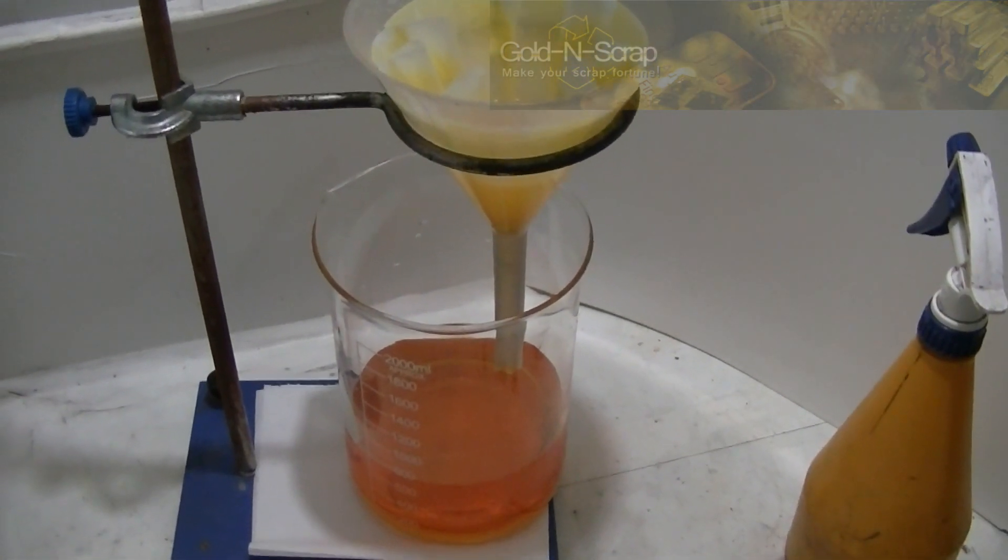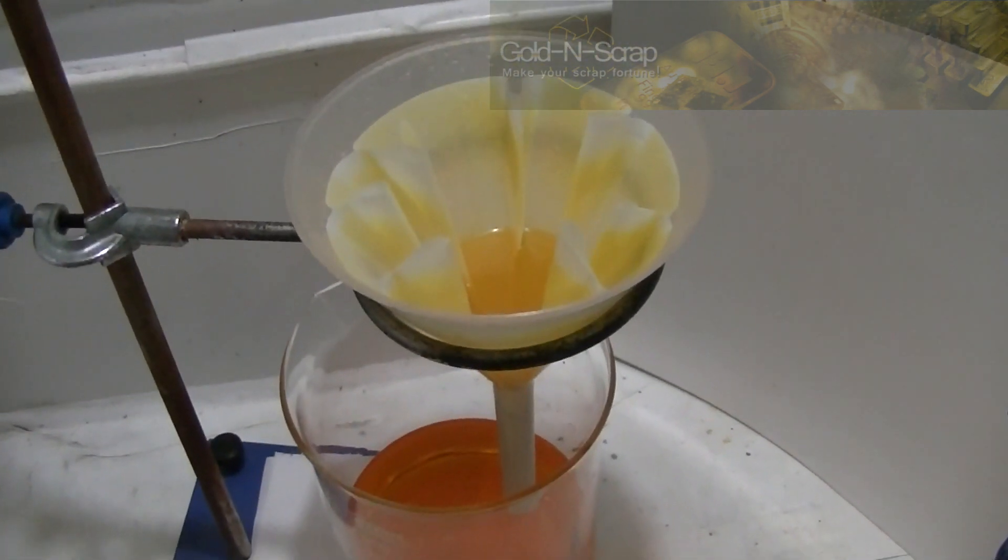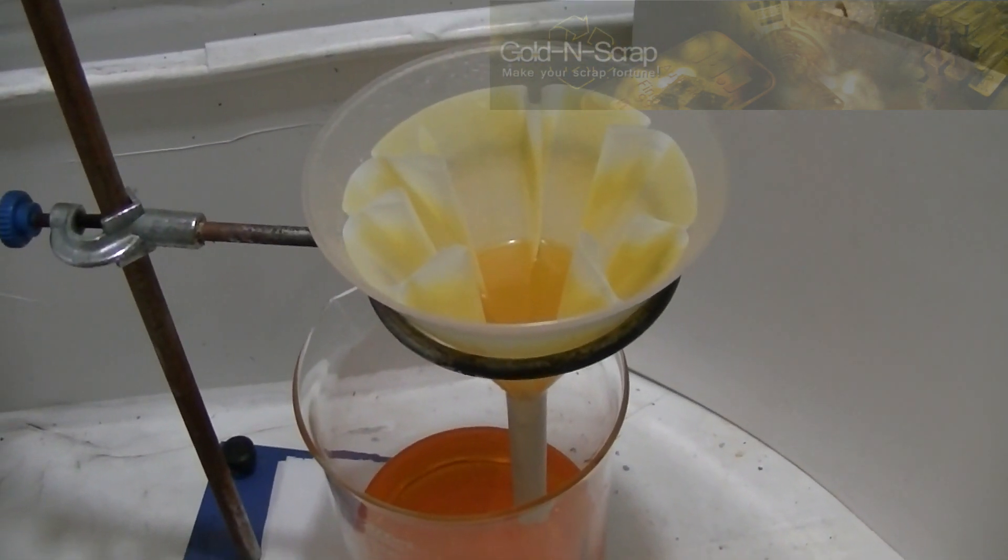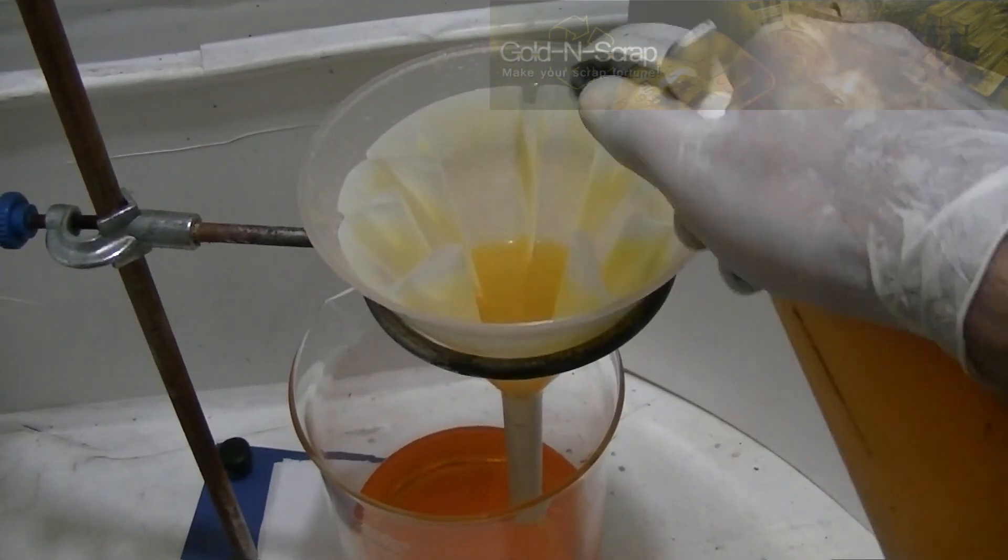Please remember to wash the filter with plenty of water so that all of the yellow gold bearing solution will run down into the receiving flask. When you are done, the filter should be white again.